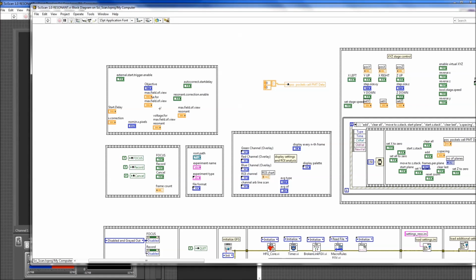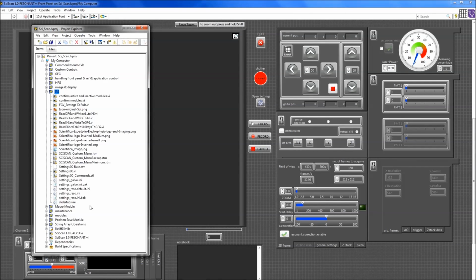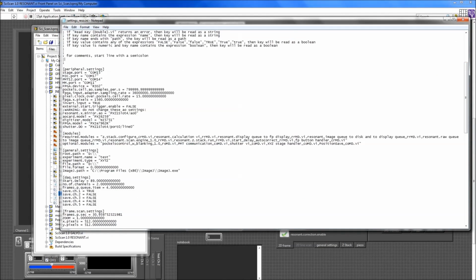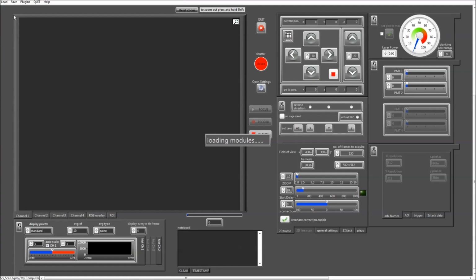We have a number of different modules that all run as top-level VIs in parallel. So if you look at your settings file, let me just bring that up for you quickly. If you look at the settings file, in this case for a resonance scanner, you'll find that you'll have a number of modules here. There's a number of required modules and a number of optional modules that depend on your different hardware settings. So everything that's listed here under modules will be loaded up when you're starting SciScan. So if I start SciScan here, you can see that it's starting to load all these modules, and then all these modules will be running in parallel.